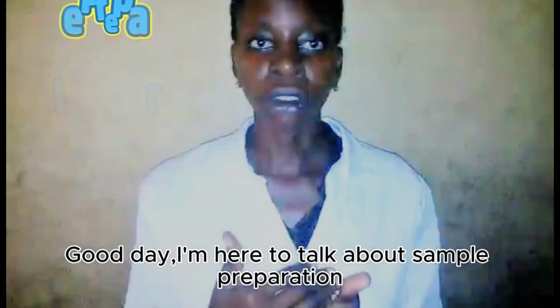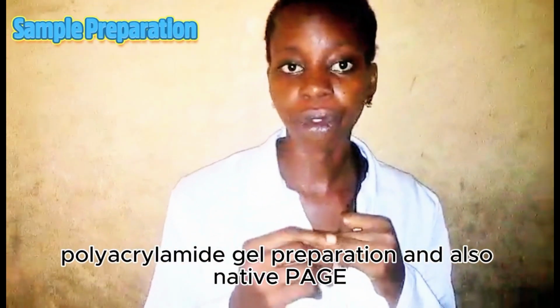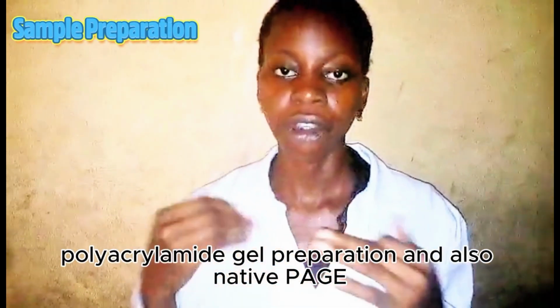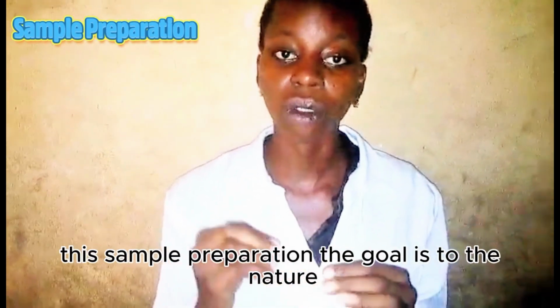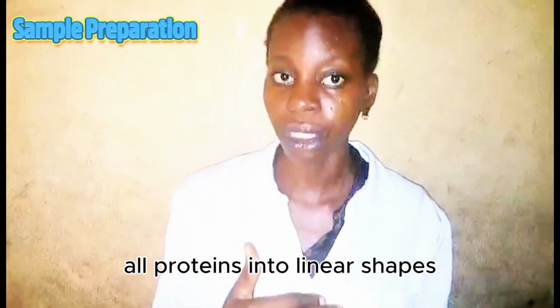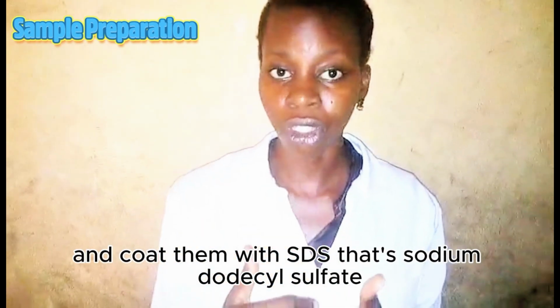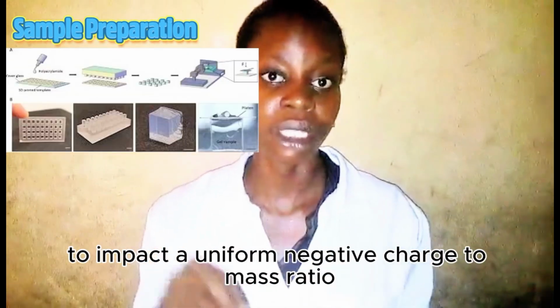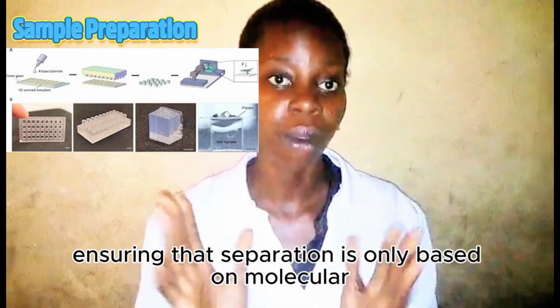Thank you. Good day, I'm here to talk about sample preparation, polyacrylamide gel preparation, and also native page. Firstly, I will start with sample preparation. The goal is to denature all proteins into linear shapes and coat them with SDS, that's sodium dodecyl sulfate, to impart a uniform negative charge to mass ratio, ensuring that separation is only based on molecular weight.